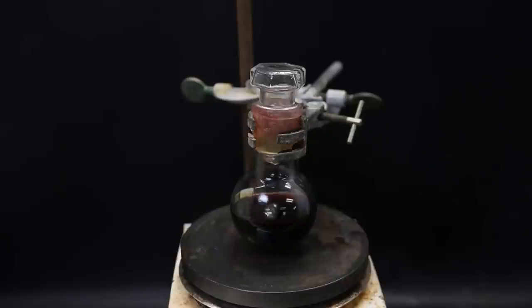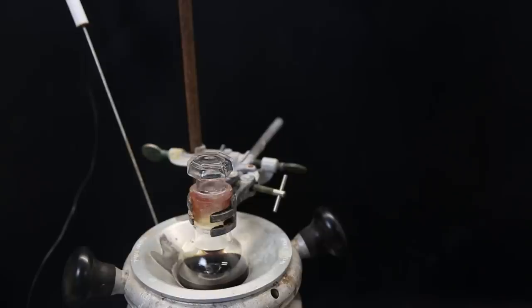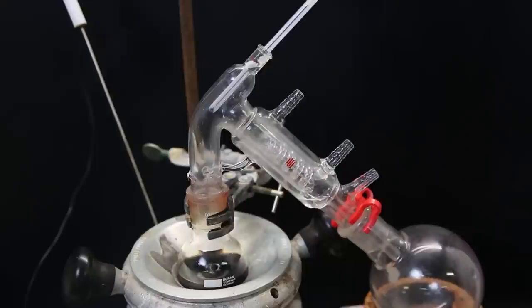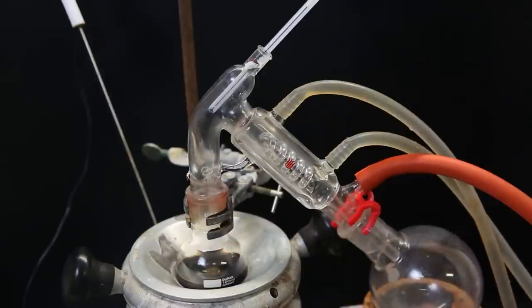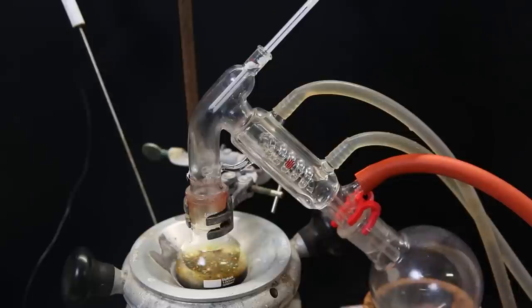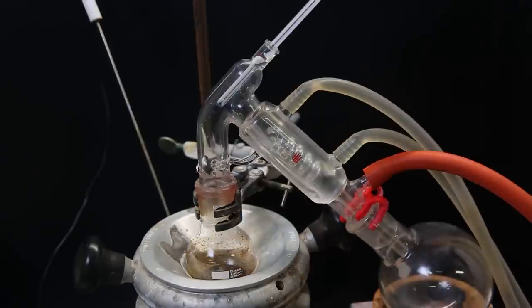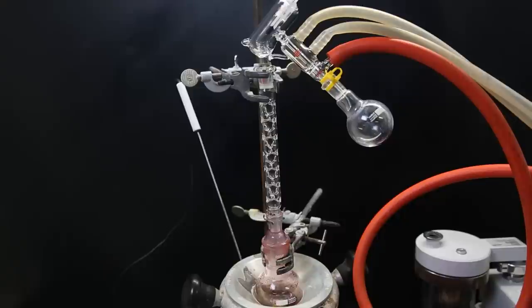I then attach a short path distillation apparatus, and pull a vacuum to remove all of the DCM, remaining thionyl chloride, and any gases that might still be present. After a while, nothing more comes over, so I remove the apparatus.